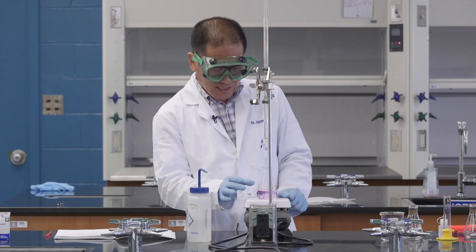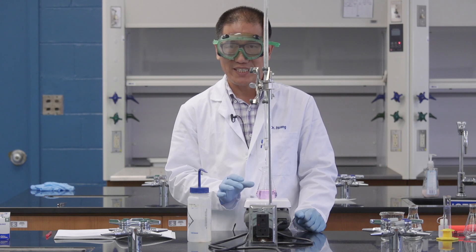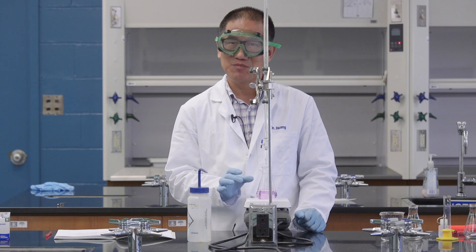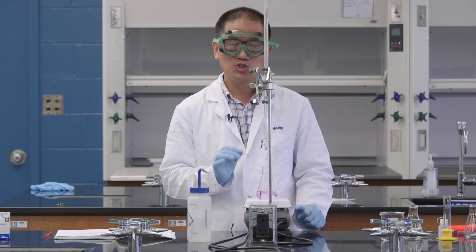As I said, you're not sure if this is the real end point. So you want to add another quarter of a drop to see if it becomes too pink. Let's try it now.